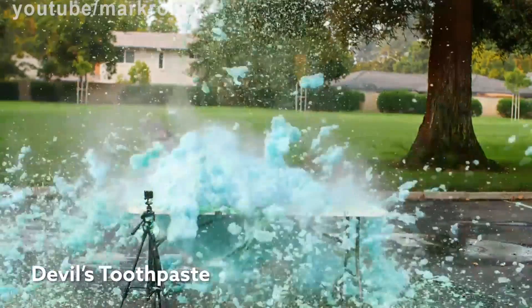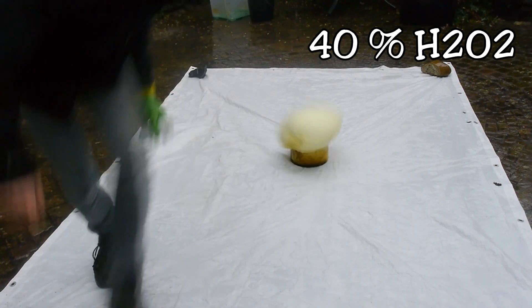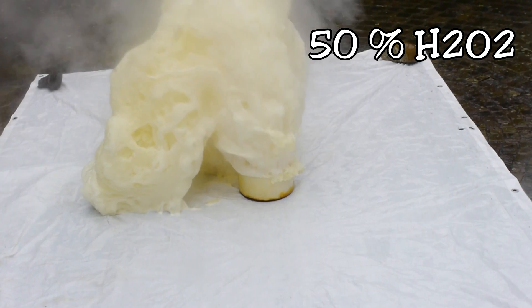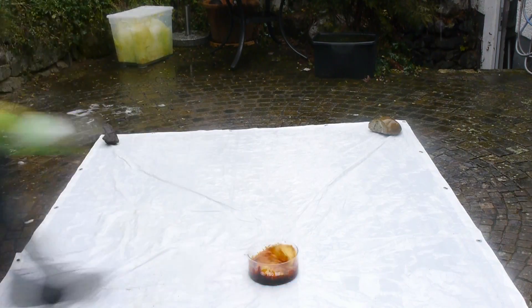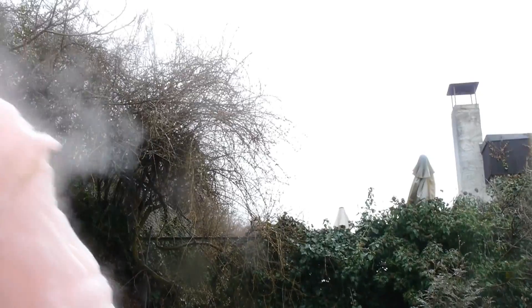In order to reproduce Mark Rober's small-scale experiments I need pretty large amounts. To get this video done in a reasonable amount of time, I first tested several concentrations on a half-liter scale. As you can see — exactly as stated on Wikipedia — the higher the concentration of hydrogen peroxide, the faster the reaction goes. At a concentration of 60% hydrogen peroxide, the reaction becomes so fast and hot that the foam is no longer stable and starts to fly away. At that point I knew I went too far, but only when you go too far do you know how far you can go.